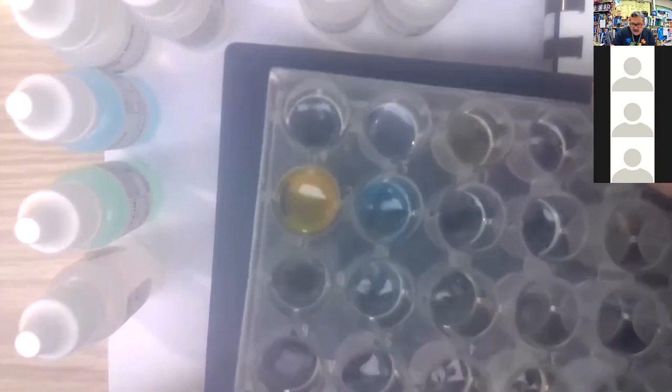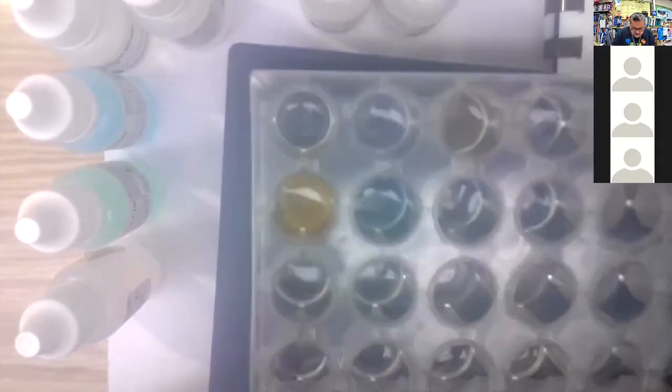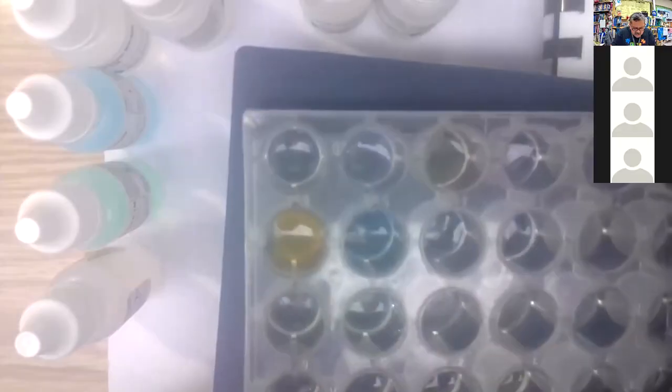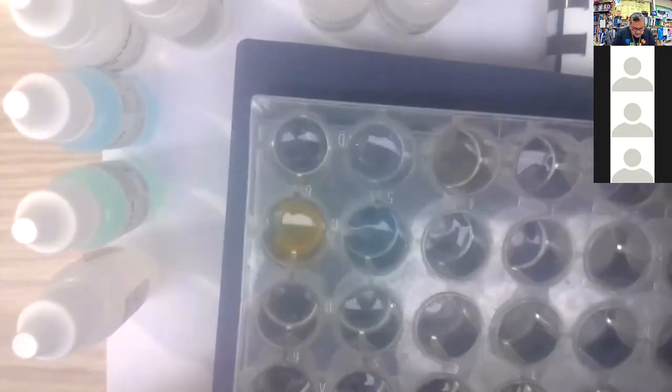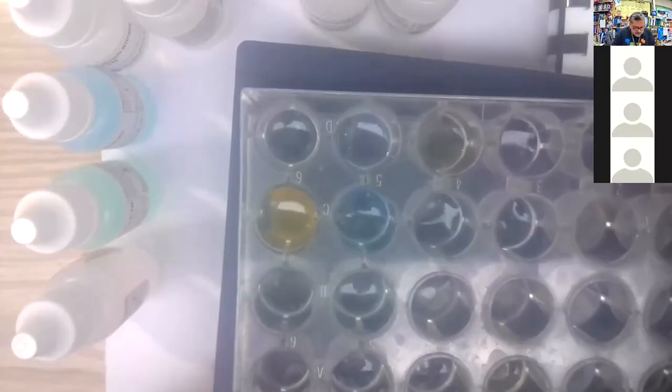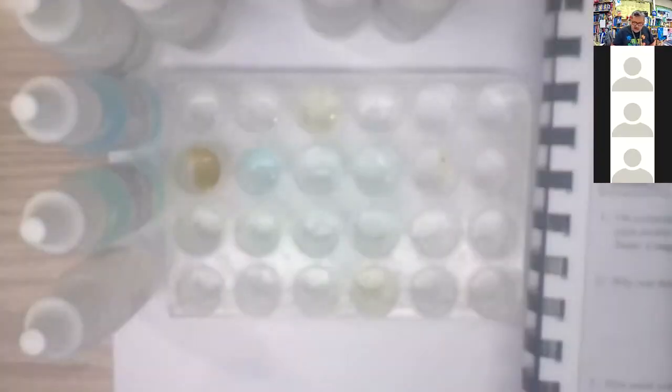And over here, this looks dirty, and you could see some coloration of the plastic, but I ran this through the dishwasher a couple times, so that's the best we're going to get. All right, so that's the second column, with the potassium hydroxide.